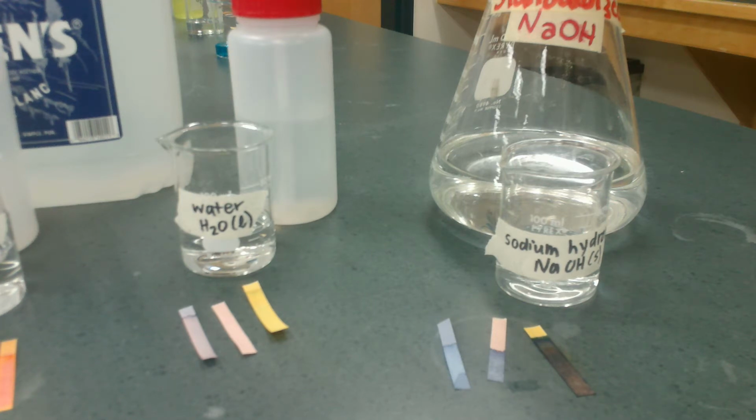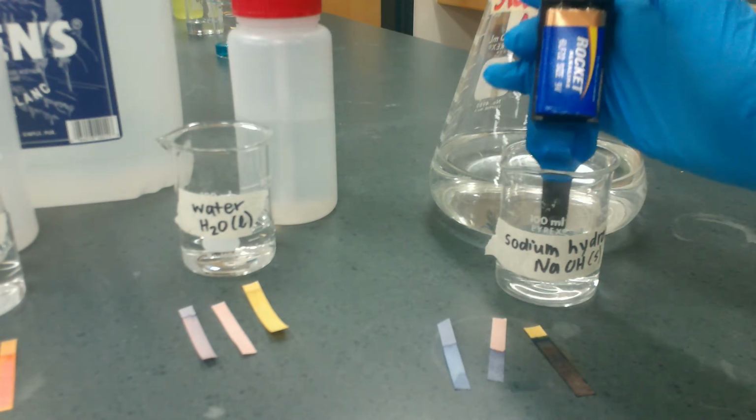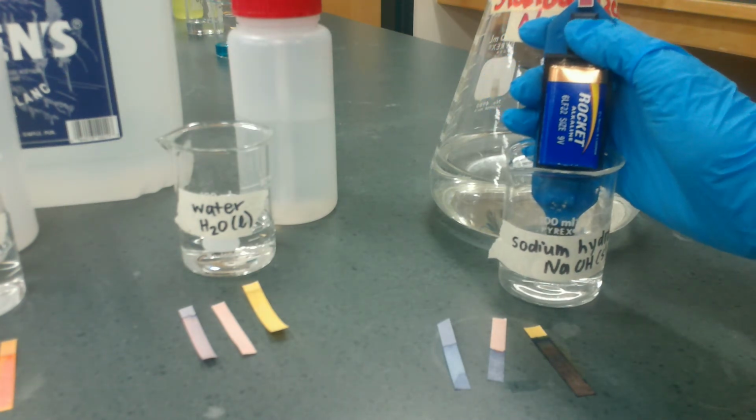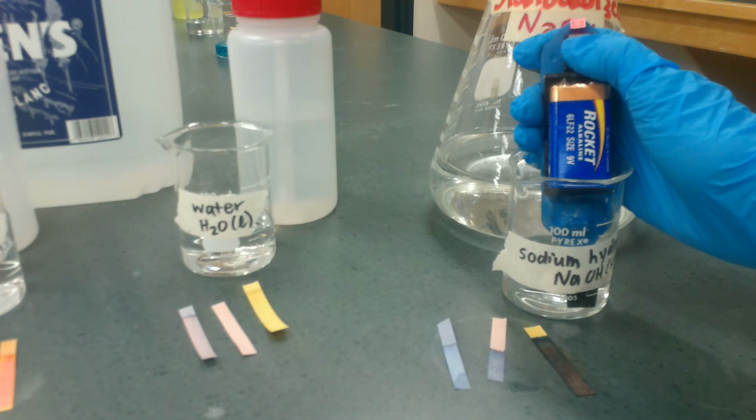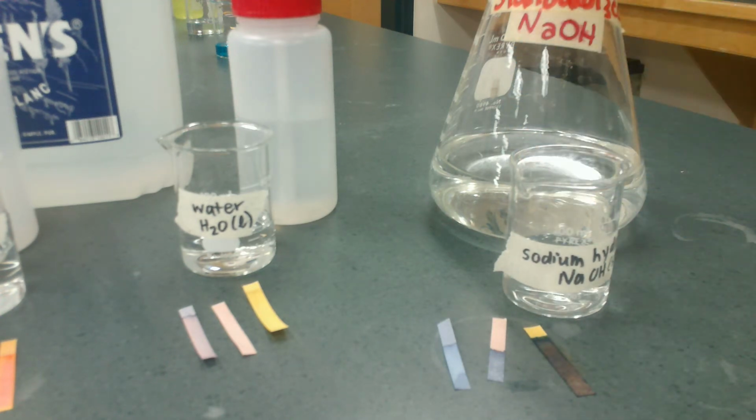So we also looked at conductivity, and when we do our conductivity testing, we just take our little conductivity meter and we press the little button and then look, oh, the light's going on. That tells us this solution is conductive. There are ions in solution. This is an electrolyte. All right, winner, winner, chicken dinner. Okay, so electrolyte solutions conduct electricity, so they include ionic compounds. So there was our example, sodium hydroxide.